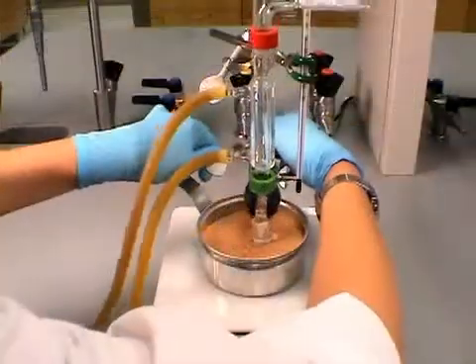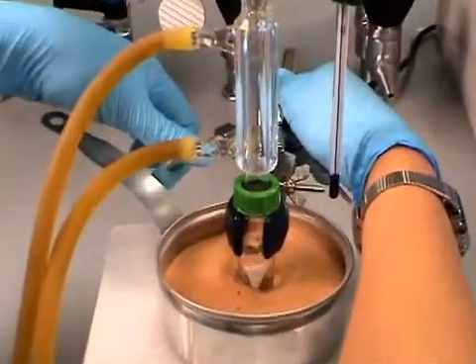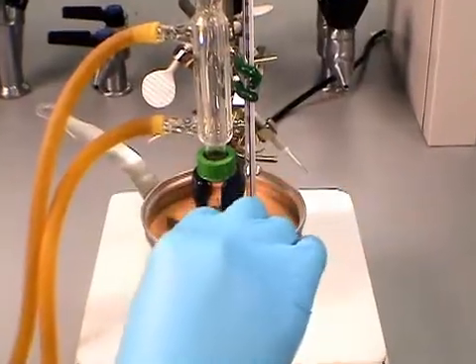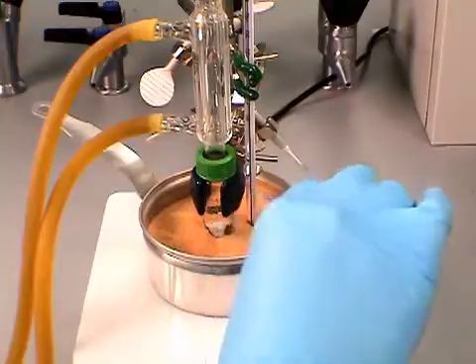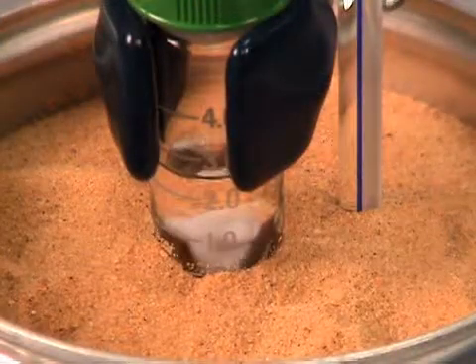Lower your reaction vial and a thermometer into a sand bath, making sure the vial is submerged in the sand with the thermometer close to the vial. Turn on the magnetic stirring and allow your reaction to reflux for the desired time.